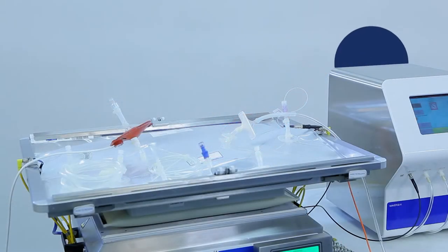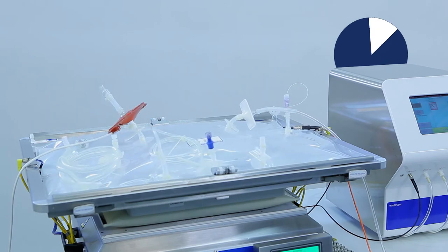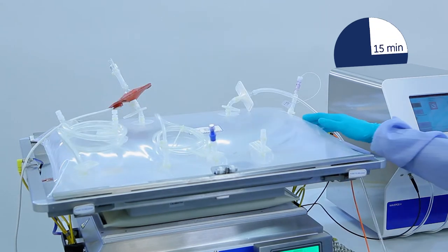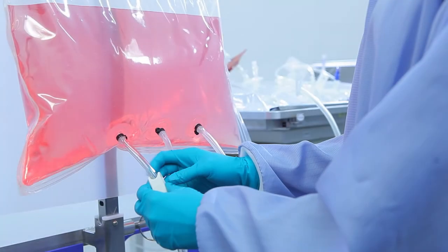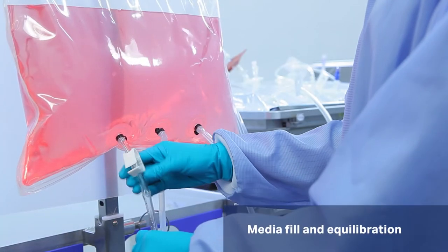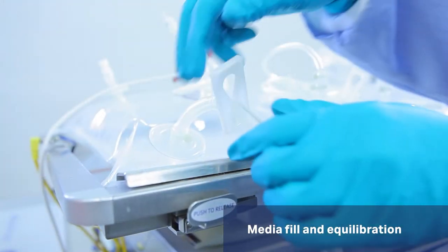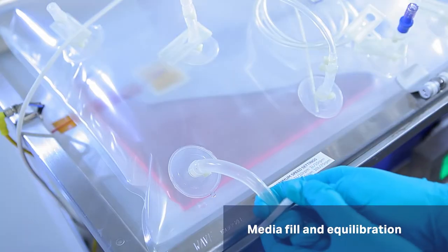Inflate the bag and attach the filter heater to the outlet filter. Use a fuser or ReadyMate aseptic connector to connect the bioreactor to the media bag to fill with culture medium.